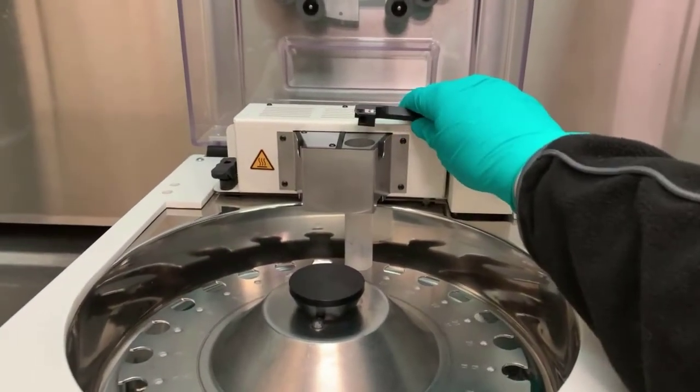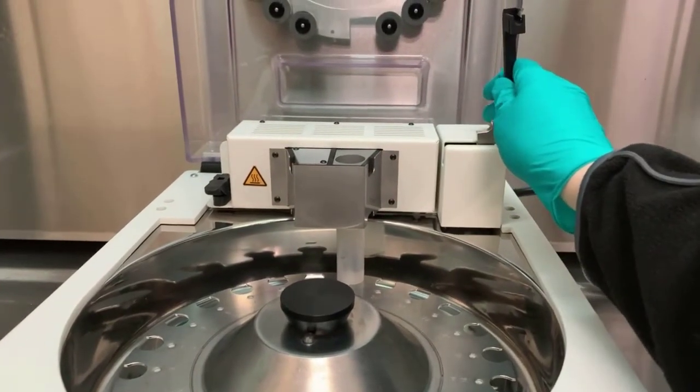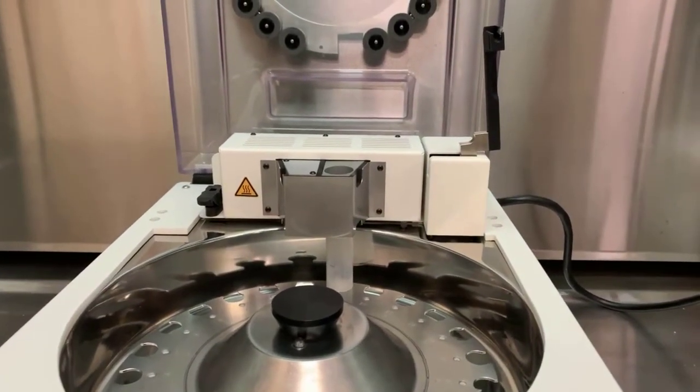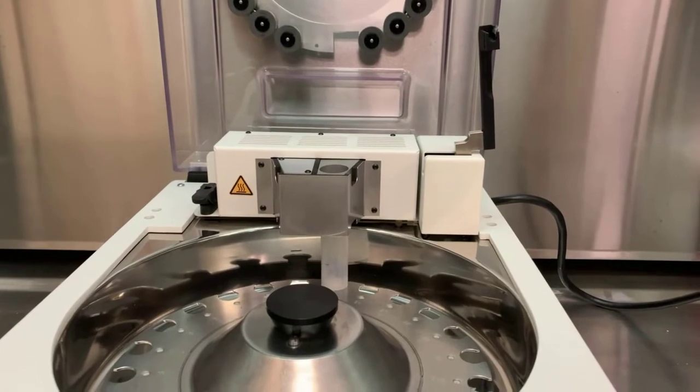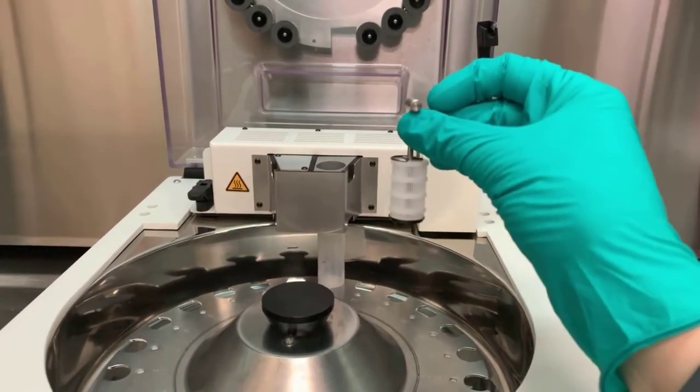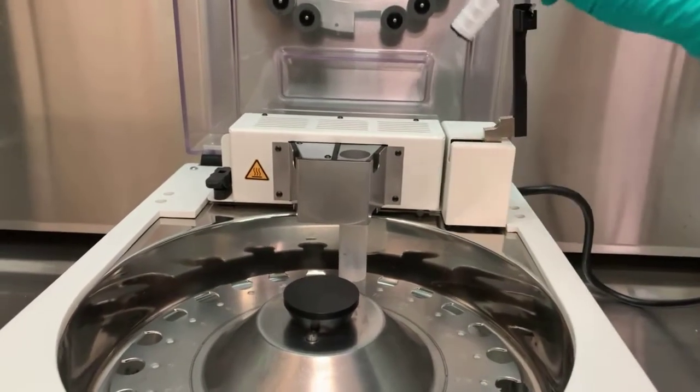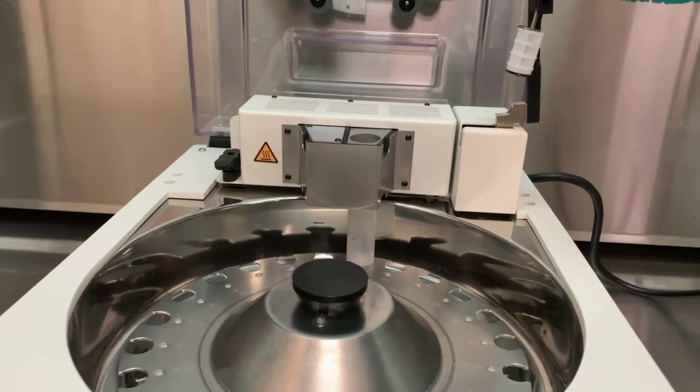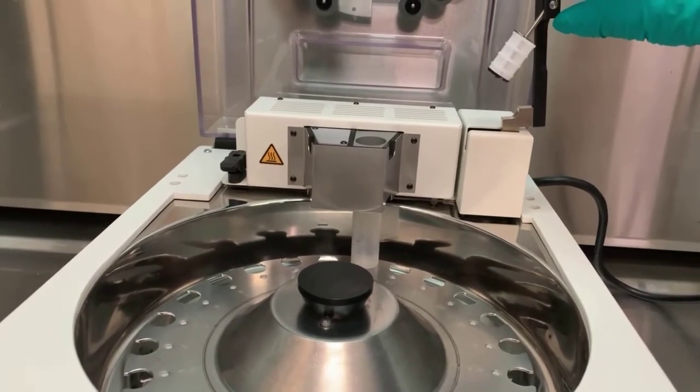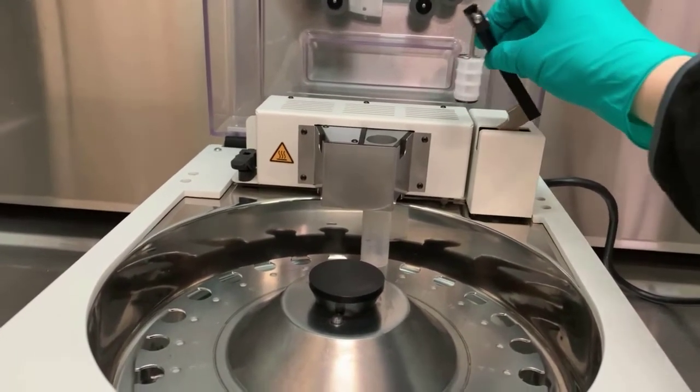The specimen arm holds a completed basket assembly. The basket assembly simply latches in place. The upper T portion of it clips into place and is intended to swing freely.